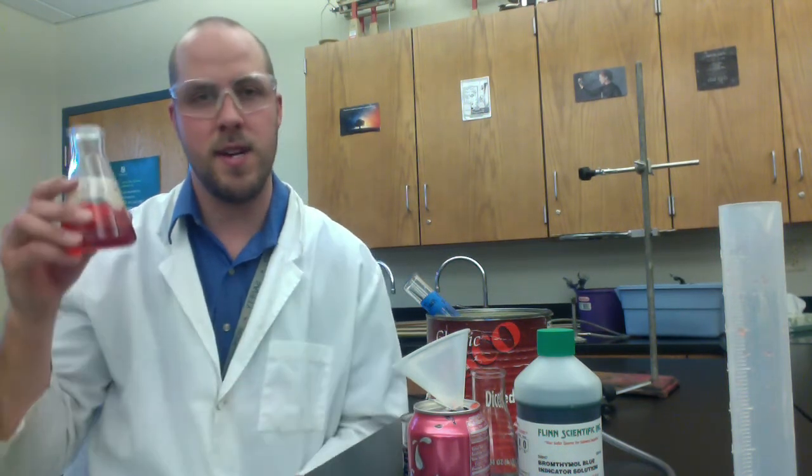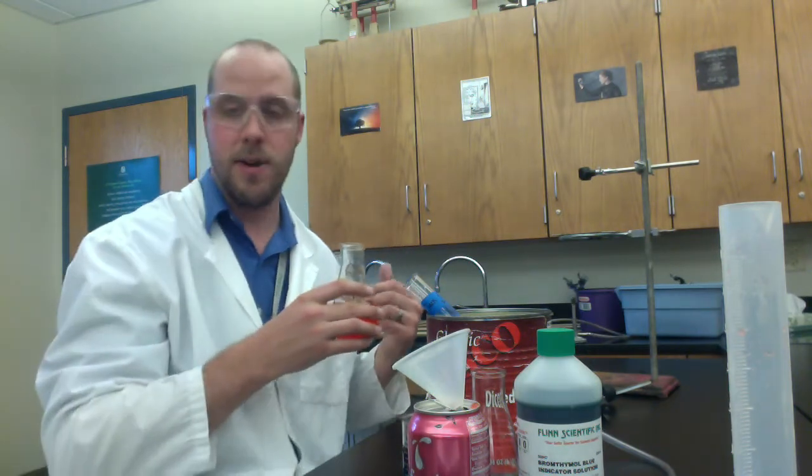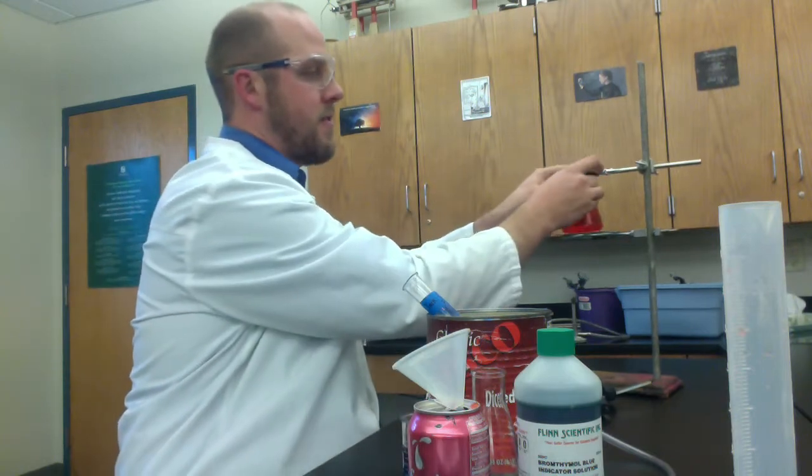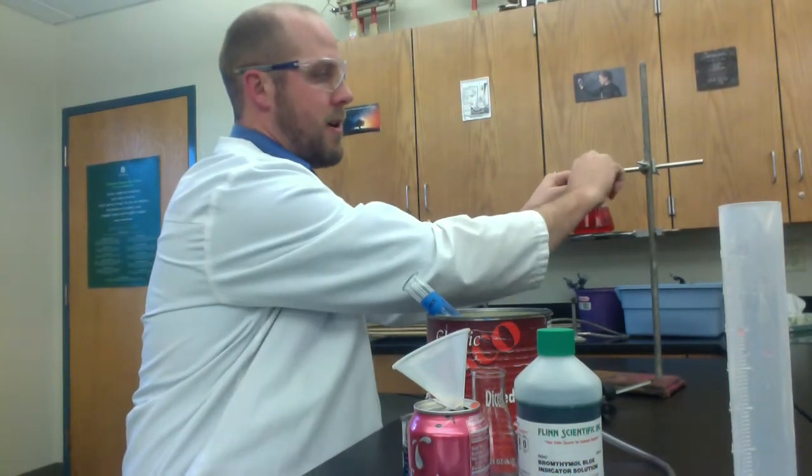Then you give it this nice red dye color and then your brain is kind of tricked into thinking it's strawberry, but it's not actually strawberry. So the fruity ester is the first component that we want to boil off.